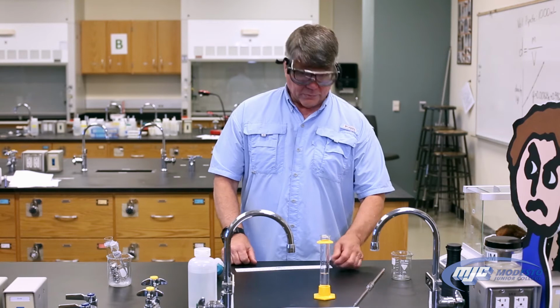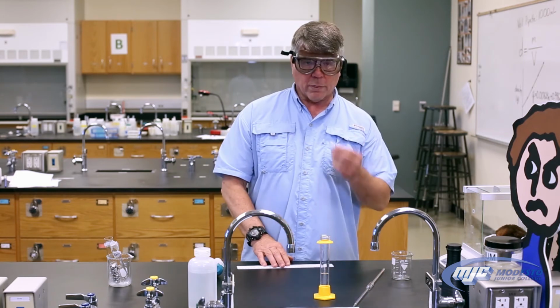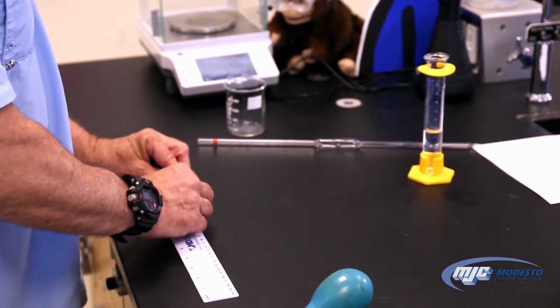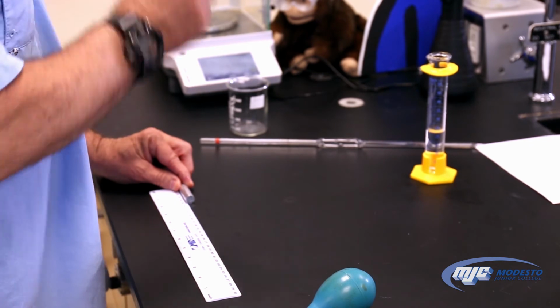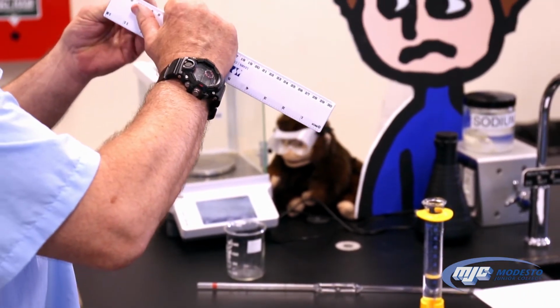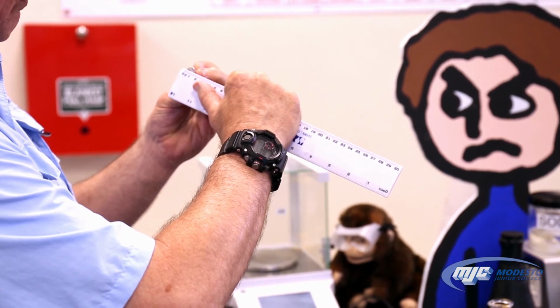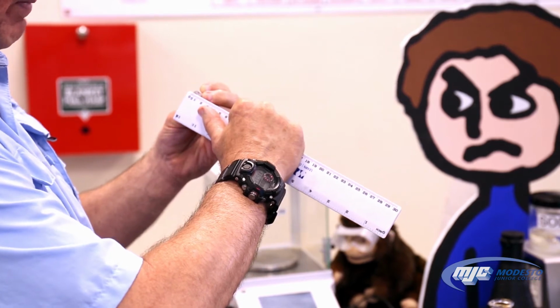All right, guys, so we're going to start with the first part, the metal cylinder. Really easy. All we do is measure the height or the length and the diameter. To measure the height, we just place one end against the 0 on the ruler, read the other end, 2 places past the decimal in centimeters. Now to measure the diameter, what I do is I line up the 0 on one side and I move it up and down until I find the largest distance. And that will be the diameter. Once more, in centimeters, 2 places past the decimal.